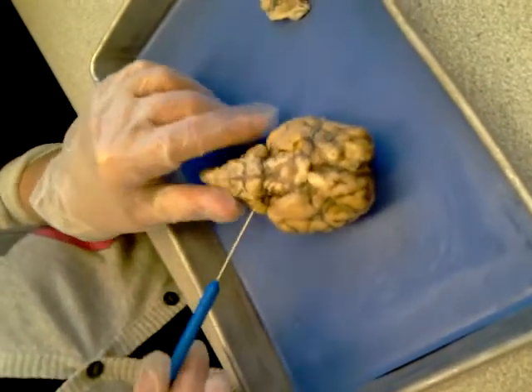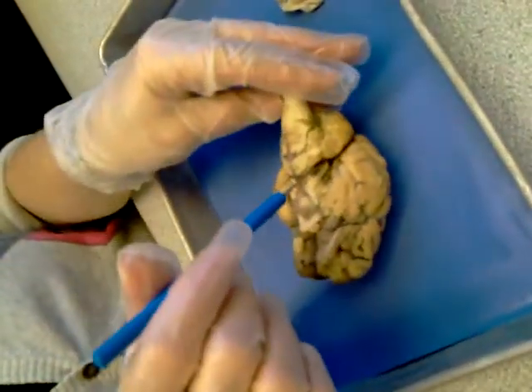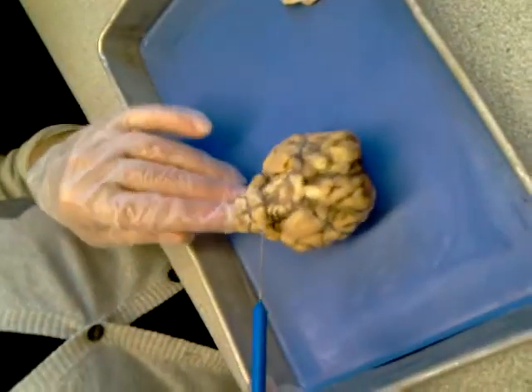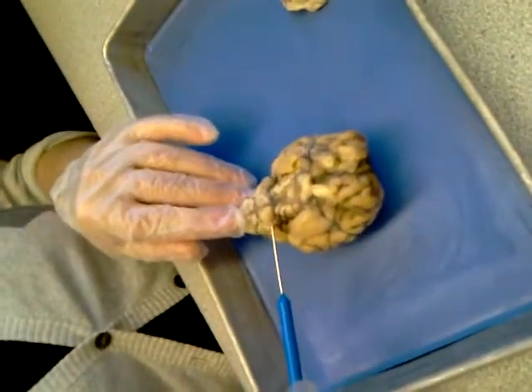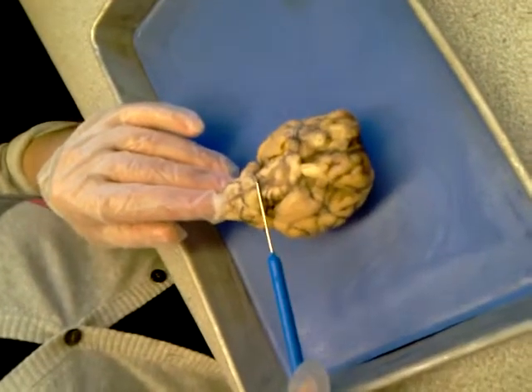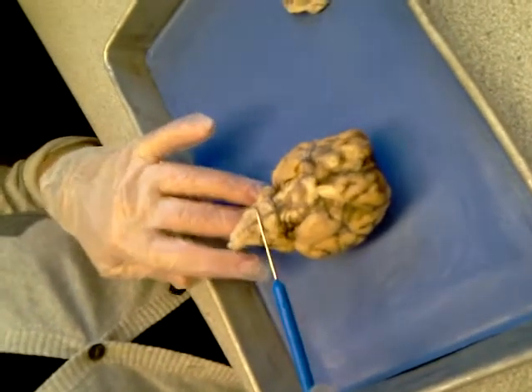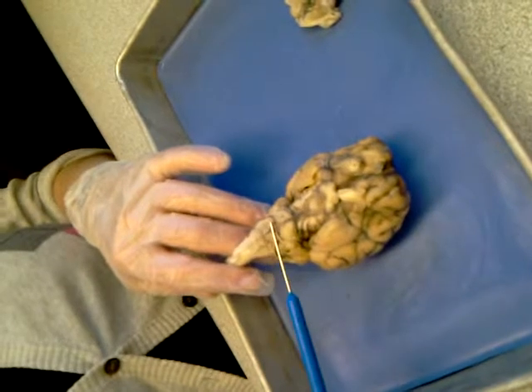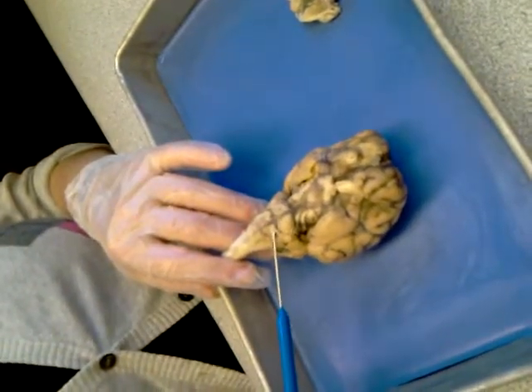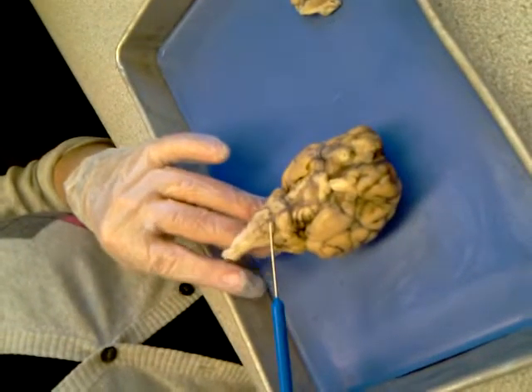Excellent, the peduncles. Then we would normally have a little nerve right there, the trochlear nerve, cranial nerve number 4. Then we would have another nerve right here. What would that nerve be? Trigeminal number 5. And that's on the side of this protruded structure. What is this called? The pons. Then we move on to this region, which is medulla oblongata, and then right between the 2 we have this nerve, which is abducens, cranial nerve number 6.